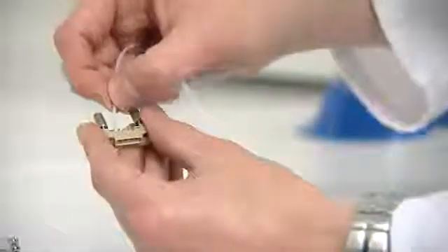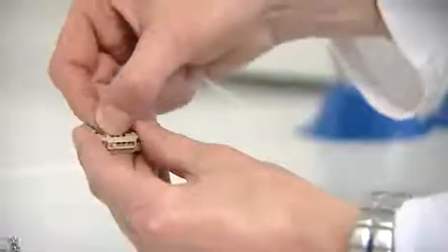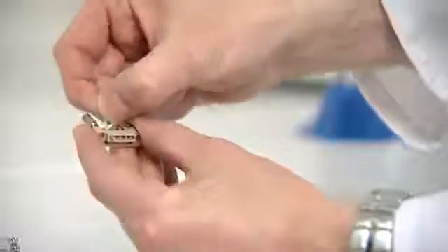First we connect tubing into a Dolomite edge connector. Each tube is pushed into the connector and then aligned and locked into place.